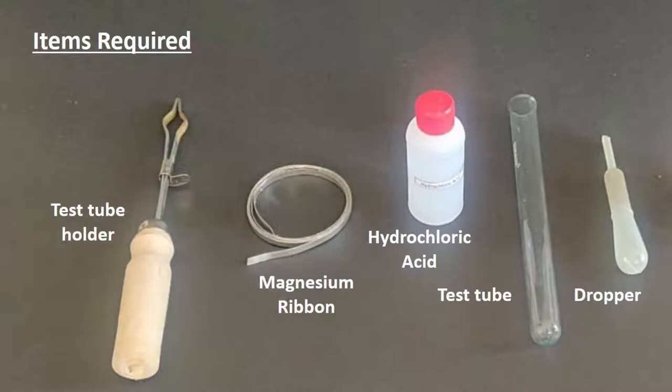For this we need magnesium ribbon, hydrochloric acid, test tube, test tube holder, and a dropper.